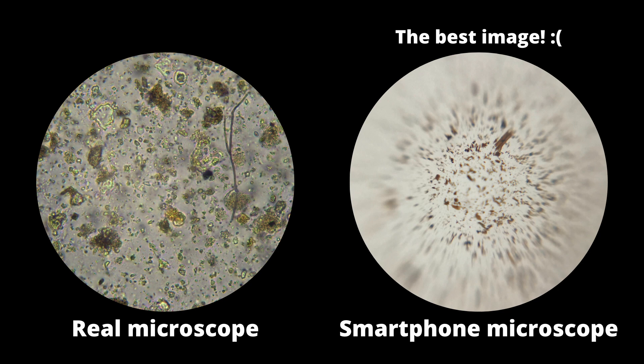In some cases I actually managed to zoom in a little bit as well, but it was just too fiddly. I even moved the little lens over and had a play in video mode — that was just too difficult as well. So my takeaway from this: can a smartphone microscope cut it against a conventional microscope? Let's put a couple of images side by side. I've absolutely no idea what magnification the smartphone microscope was operating at.